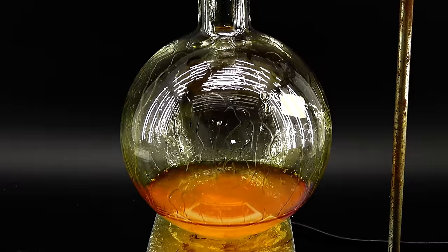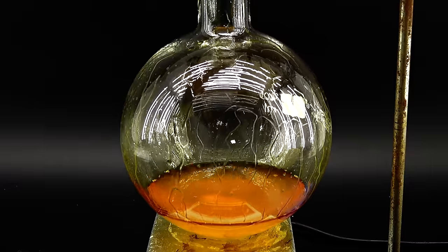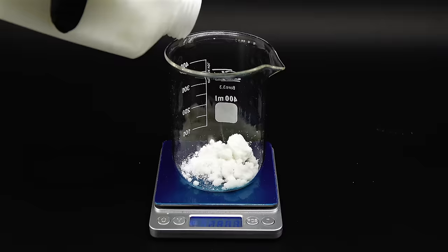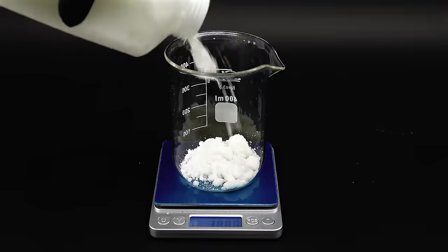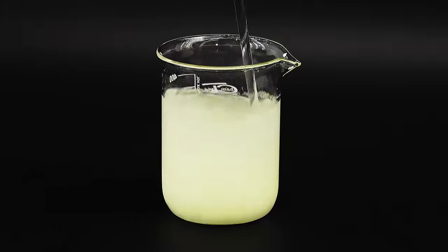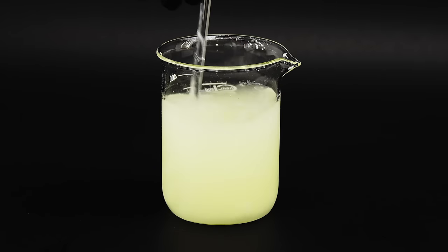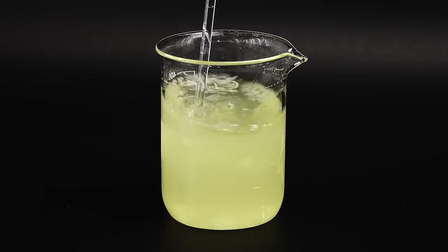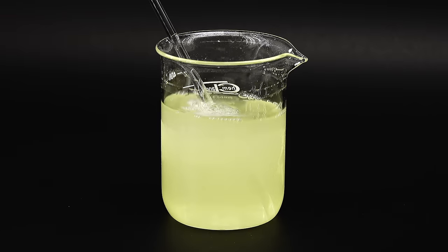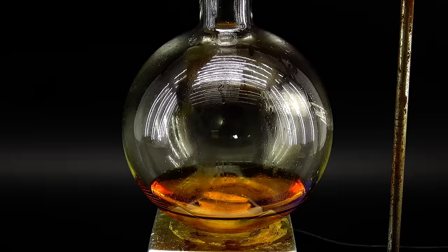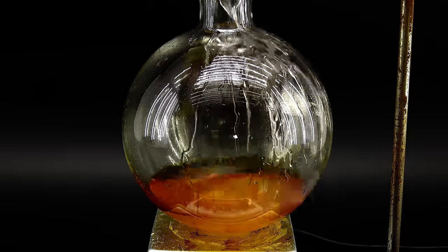I now again have to prepare a solution of sodium nitrite, and for that I weighed out 141 grams of it and dissolved it all in 240 milliliters of distilled water. This solution is so concentrated that the nitrite had some trouble dissolving. Fortunately with some manual stirring I managed to get most of it into solution and then poured everything into the reaction flask.